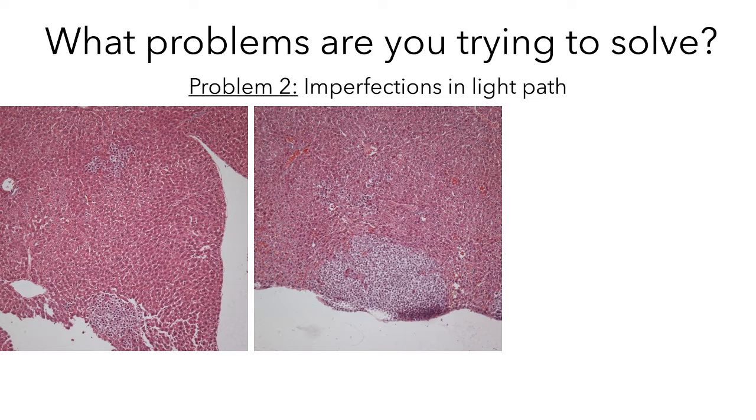And if you look more closely, and the video might not have the resolution for you to see this, some of the other imperfections in this area also seem to be strikingly similar between these two images taken in different locations, suggesting that they have nothing to do with the sample and they're a feature of the microscope, a non-desirable feature of the microscope. So in fact, if we take an image without any sample, now we see that indeed that blob near the left-hand side had nothing to do with the sample. It's something intrinsic to the microscope, as is a lot of the stuff here.